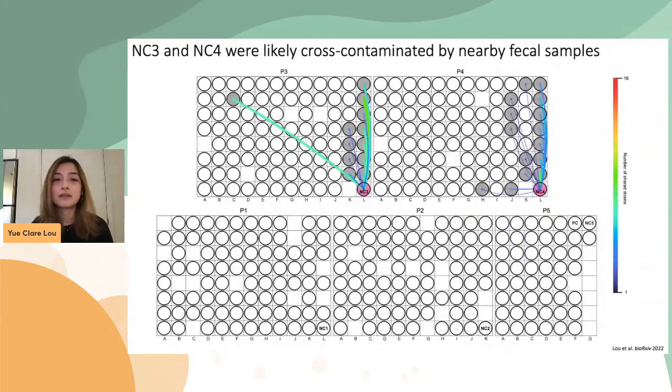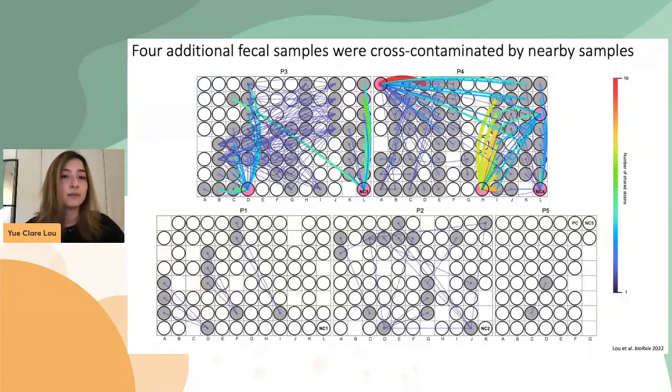So after seeing this data, we were wondering, and also worried at the time, whether there were any other fecal samples that were cross-contaminated. To answer that, we looked for strain sharing among all sample pairs from unrelated infants. And then we visualized such strain sharing patterns in the context of DNA extraction plates. And this is what we saw. P3 and P4 look quite busy, while P1, P2, and P5 look quite clean.